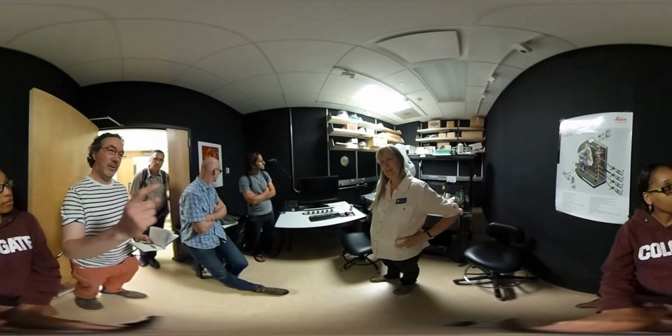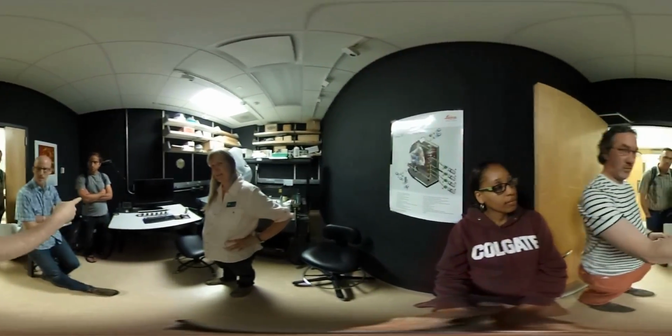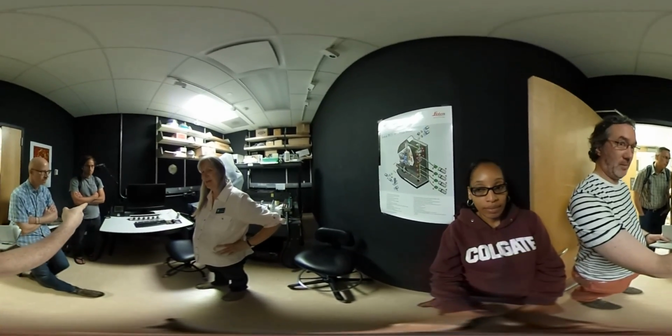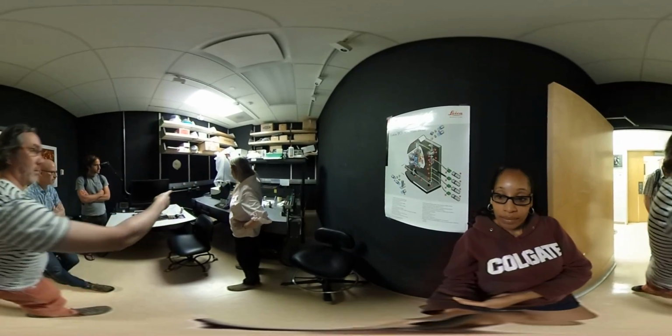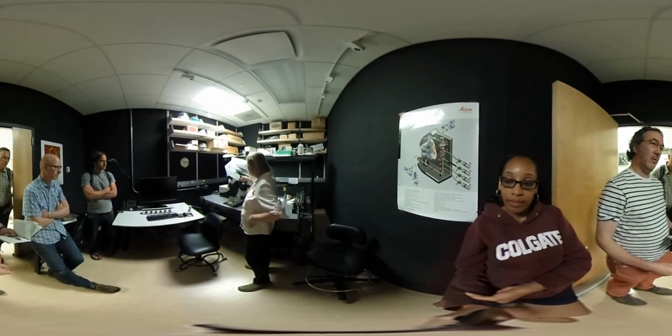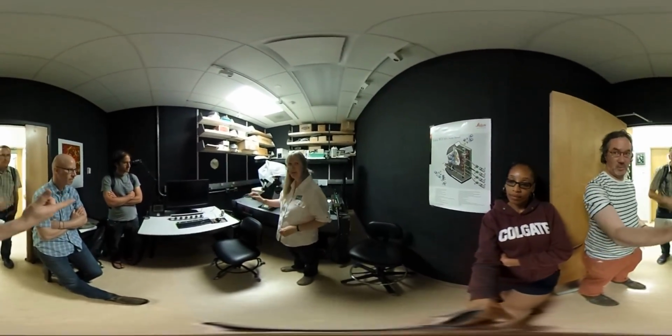I thought that in this kind of microscope, the way to see what you are putting underneath is through the digital image. Yeah, and that's what we do. You have to collect the image using a series of lenses, and you're really focusing the beam and collecting all of that information using a regular microscope. But then, the image is really there.